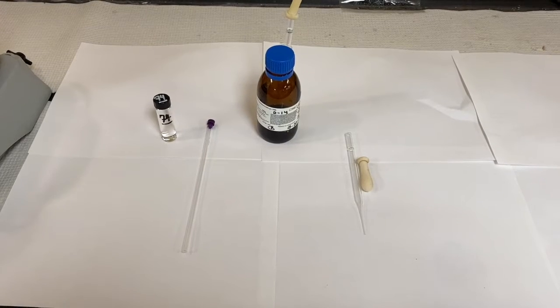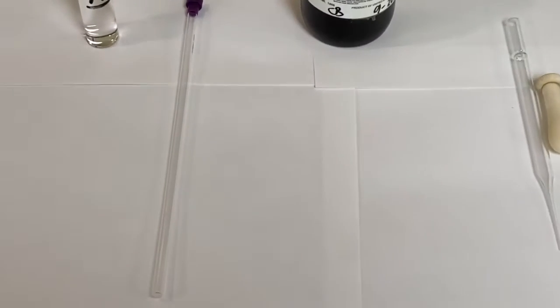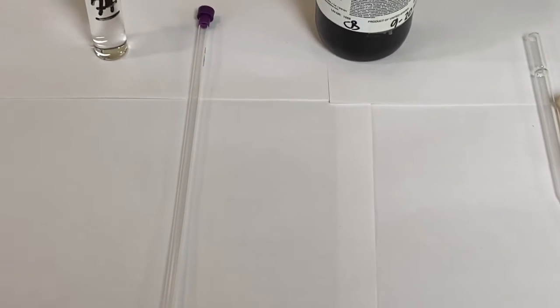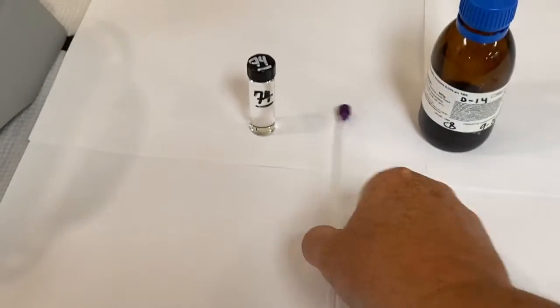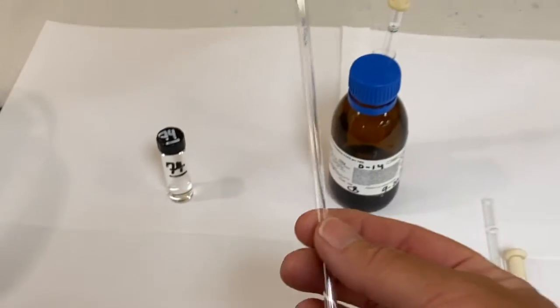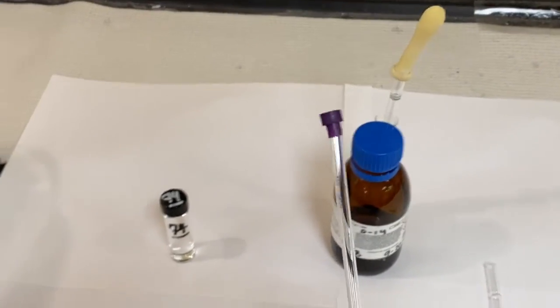One is the unknown. The second is the NMR tube. That's found in your locker and it's a thin glass tube with a top.